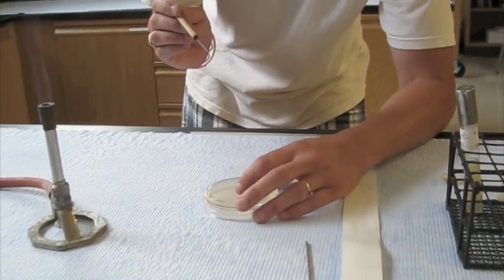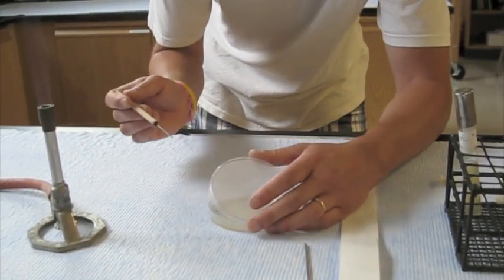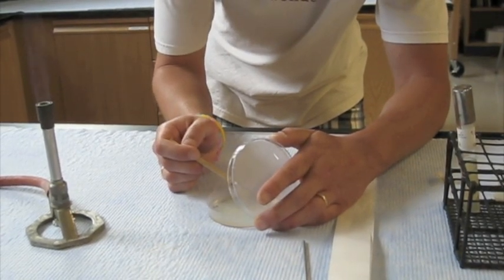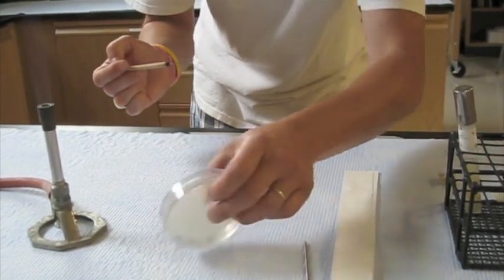And then close it, flip it back, and then put it into the tube. So I'm going to flip, tip it, and then I cool the needle off on the side here, grab a little bit of this colony, flip that back.